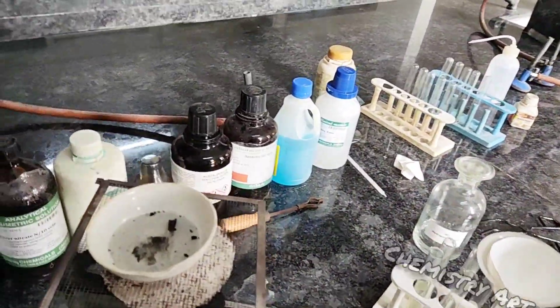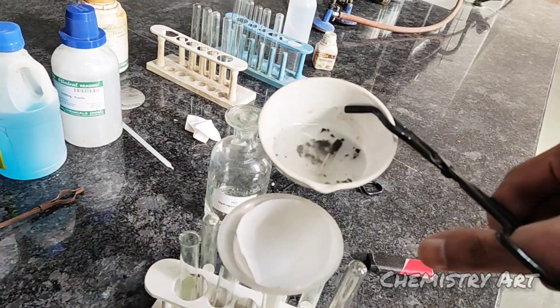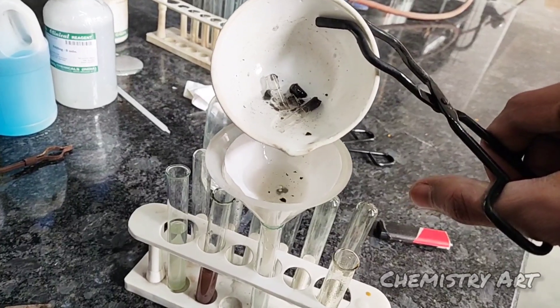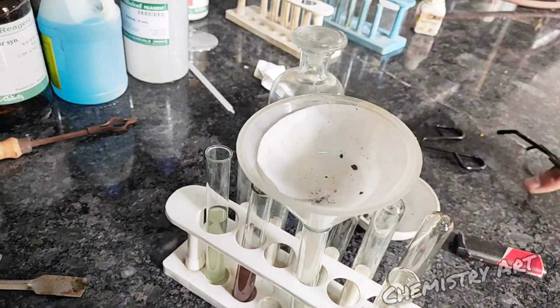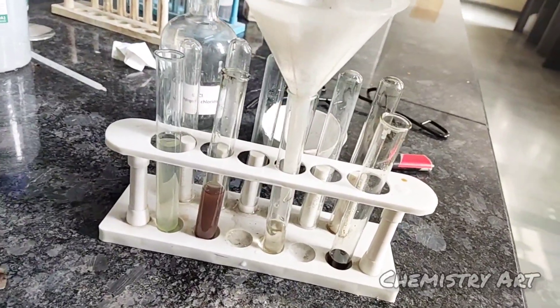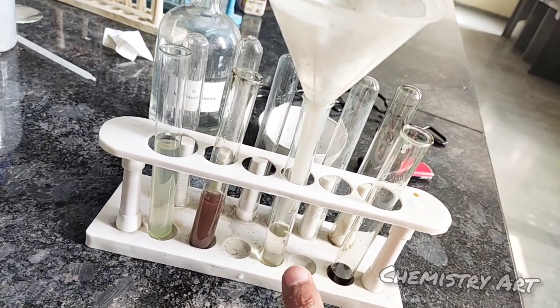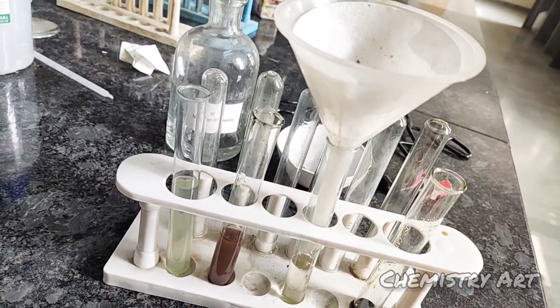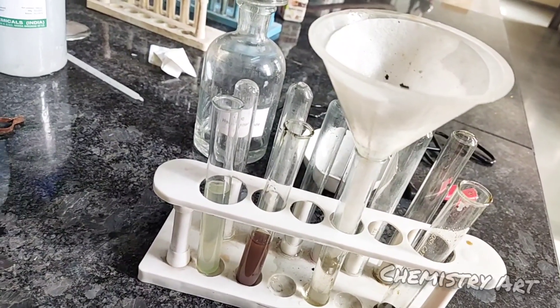I am holding the china bowl with tongs and slowly filtering it. Make sure your filtrate does not mix with the broken pieces of the fusion tube. Now you can see the clear sodium extract — the Lassaigne extract — is ready. It is quite hot, so give it time to cool before performing the test of nitrogen.